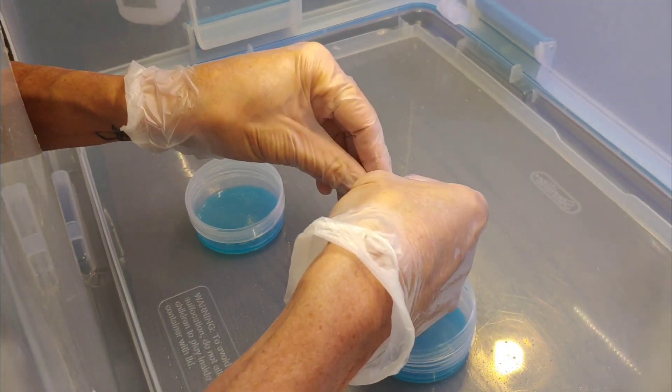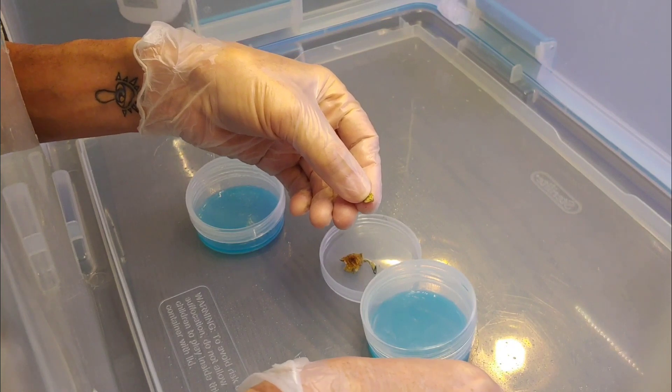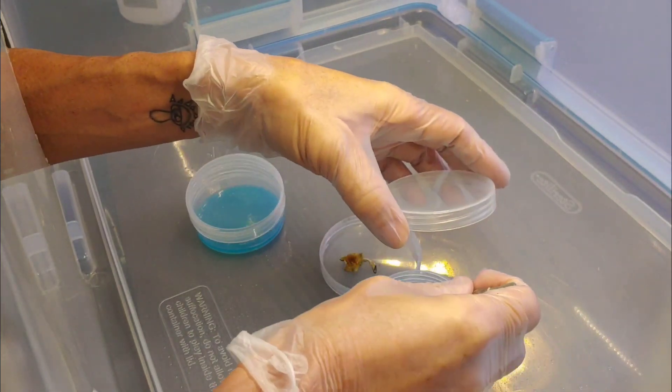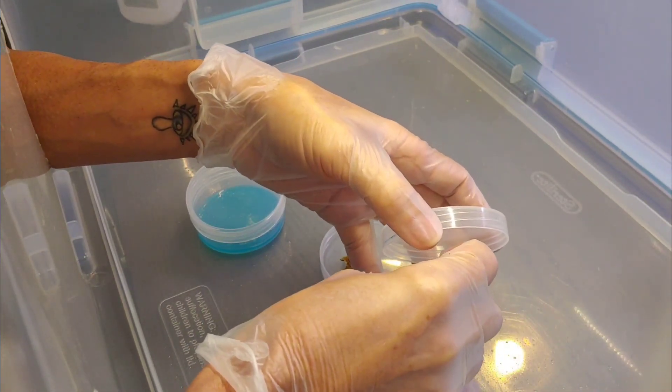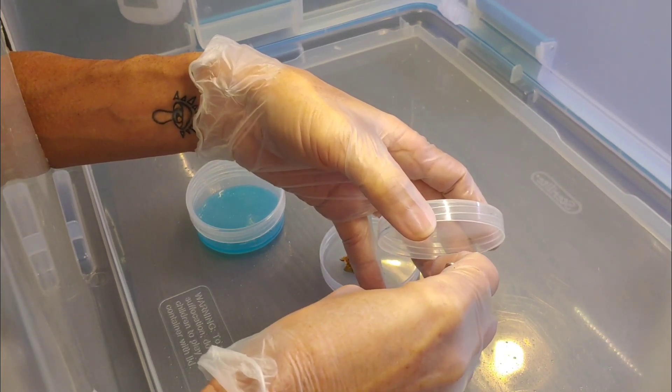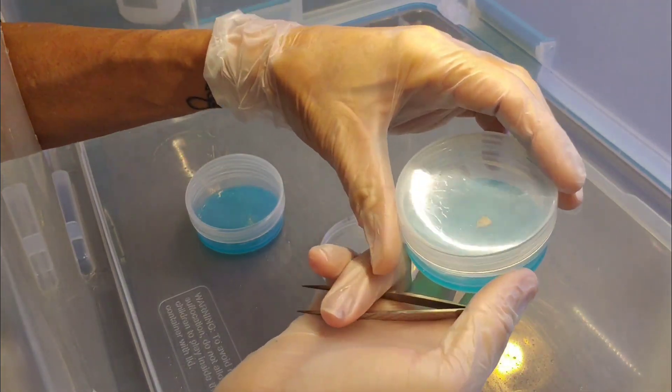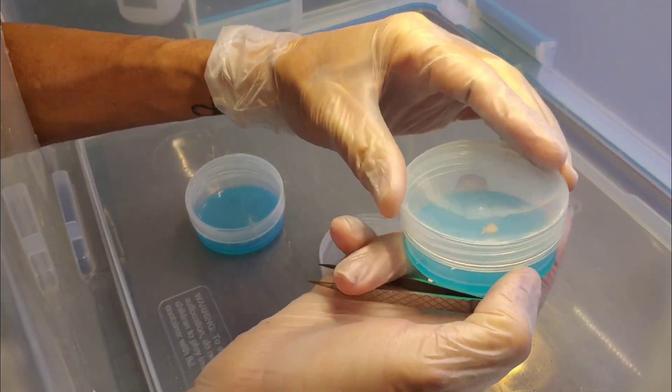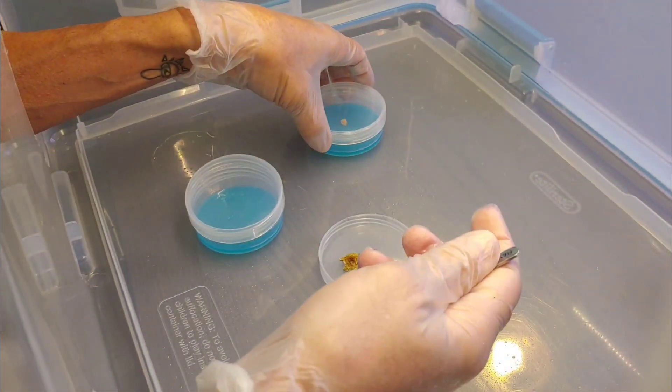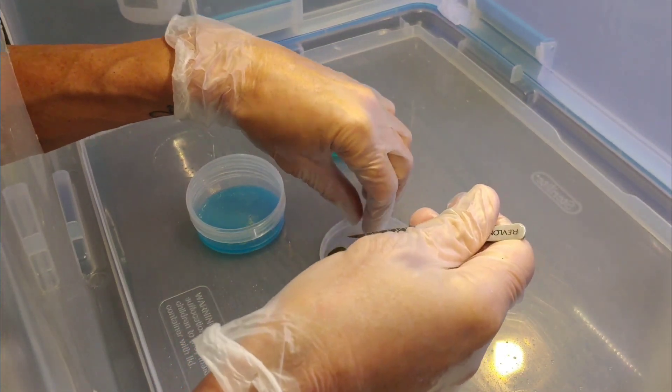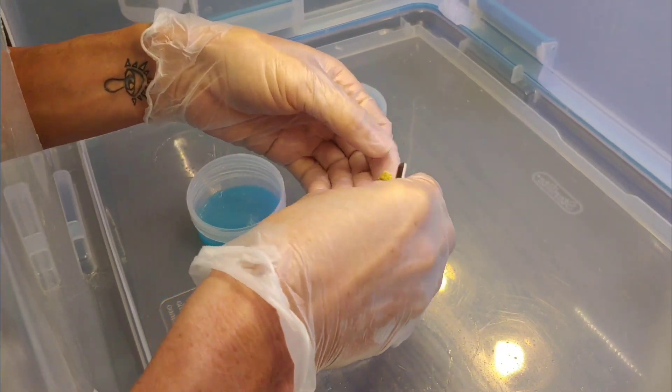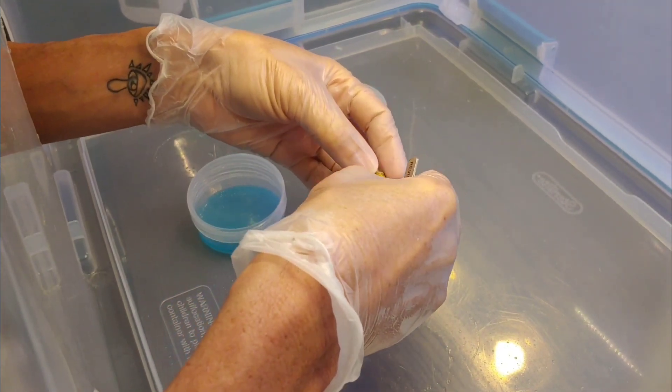This is not the best way to do this. If this was a fresh specimen, I know it would work perfectly. But this is not fresh and these are not sterile conditions at all.